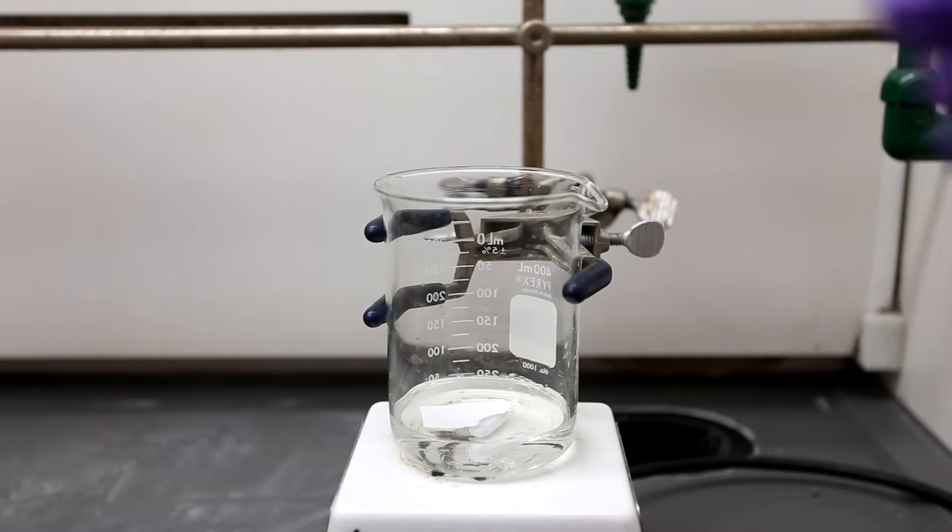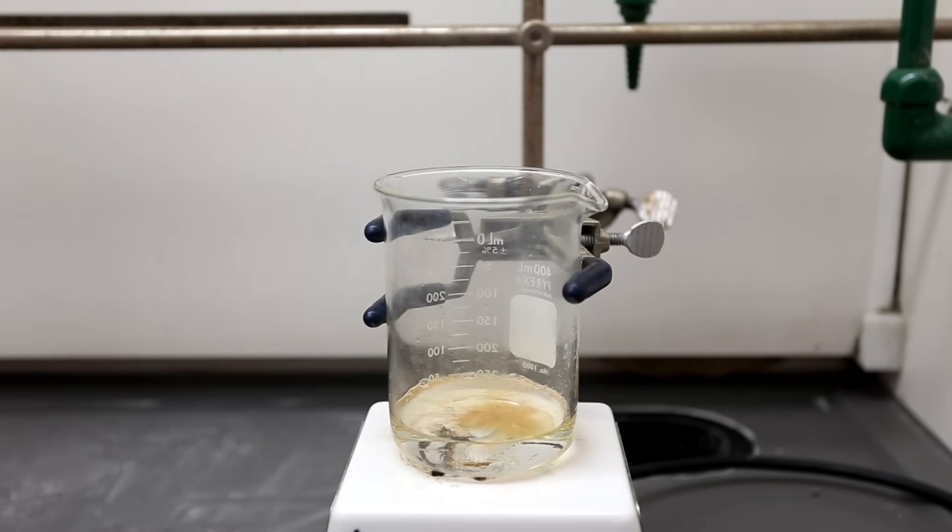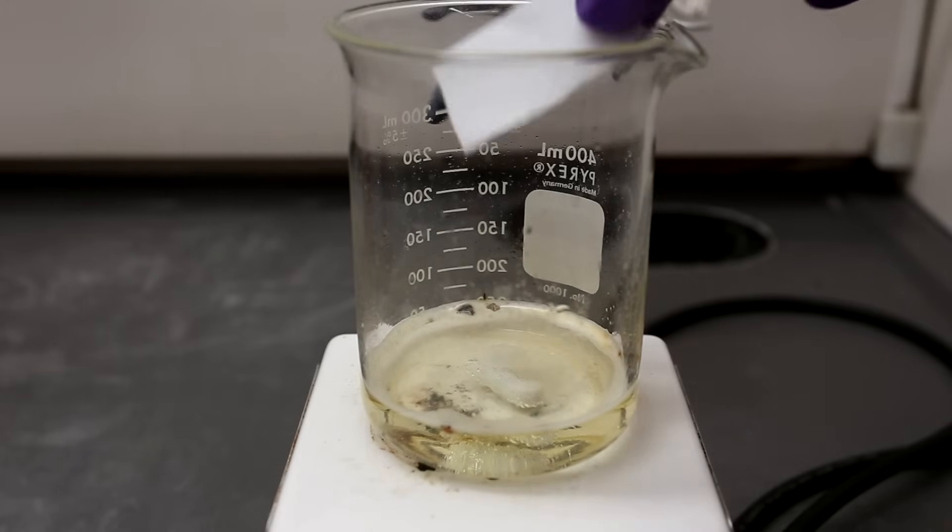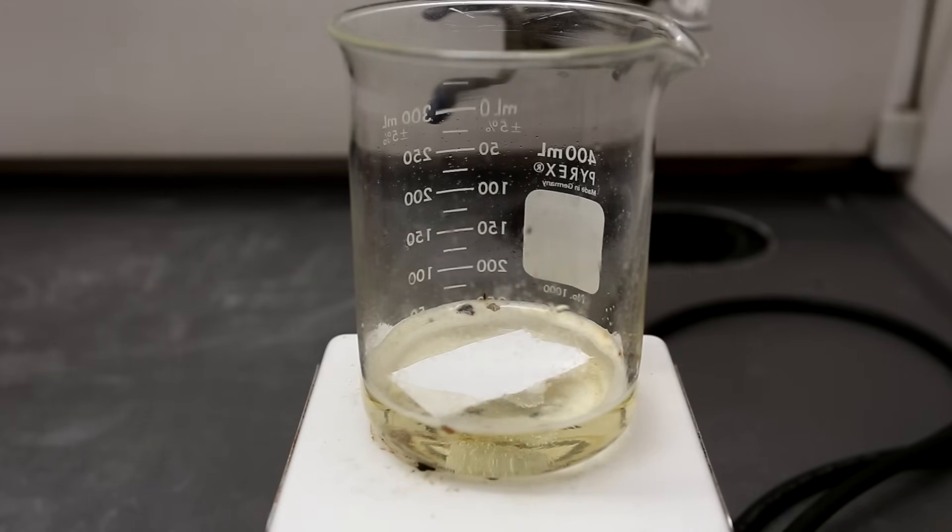A small piece of white printer paper was added to the solution. The strong oxidizing power of the piranha solution is quite evident.